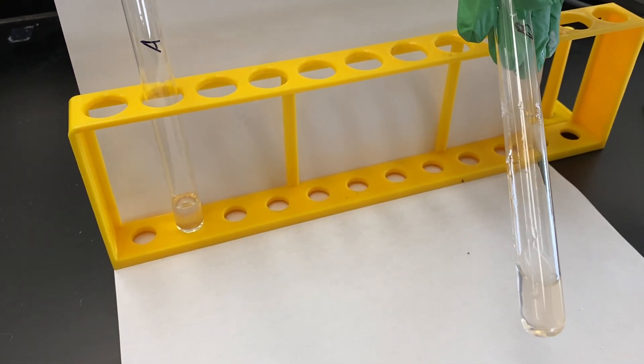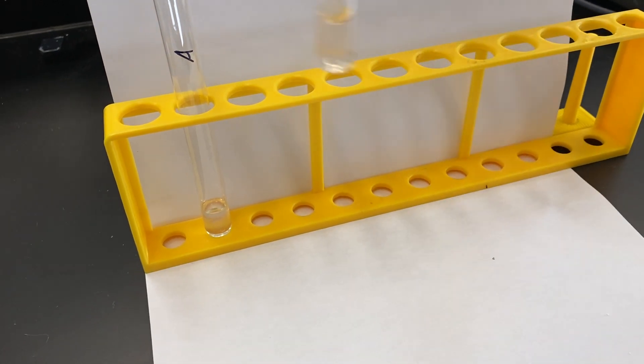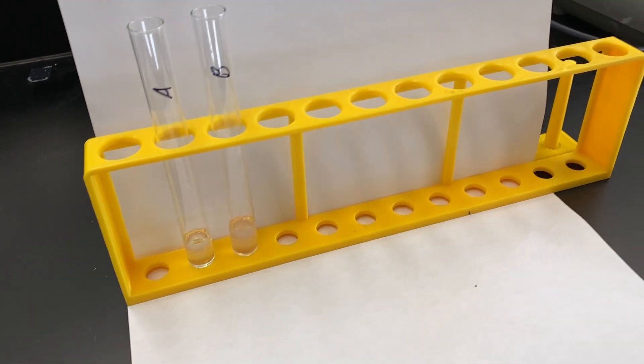Use your key to decide what that is. You could say colorless or light yellow. I'm seeing light yellow. Again, that's pH 4.